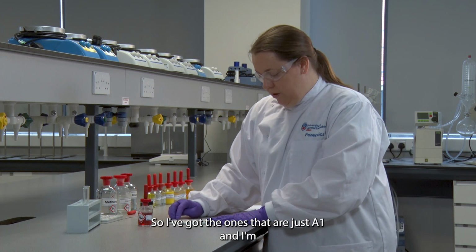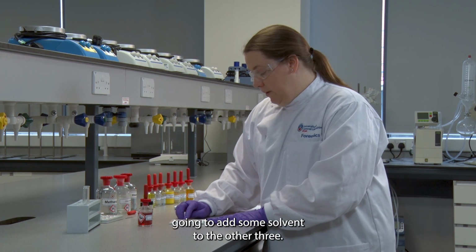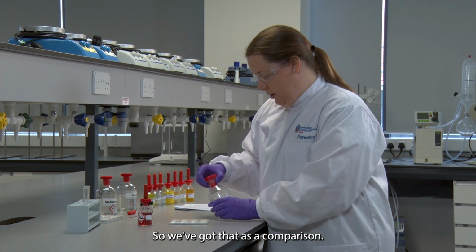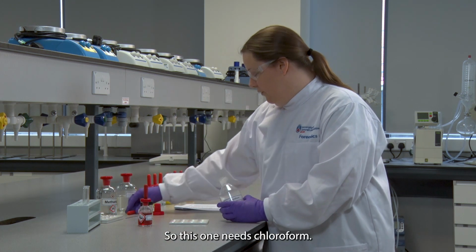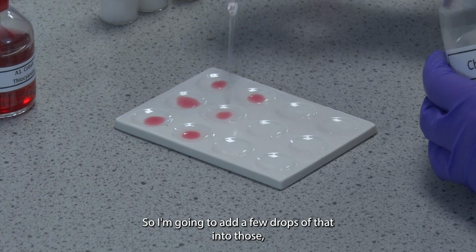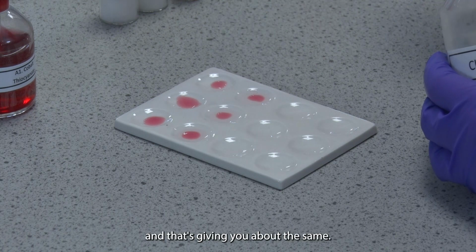So I've got the ones that are just A1, and I'm going to add some solvent to the other three, so we've got that as the comparison. This one needs chloroform, so I'm going to add a few drops of that into those, and that's giving you about the same.